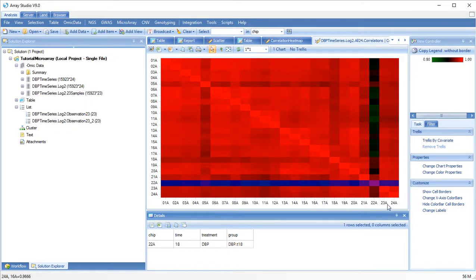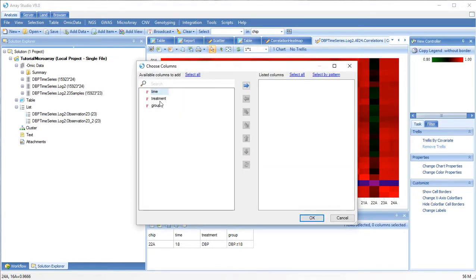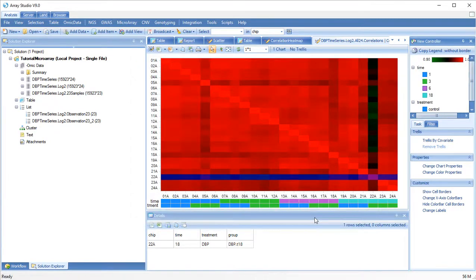Let's add a color bar to this heat map. Chip 22A in the 18-hour group of DBP treatment is an outlier.